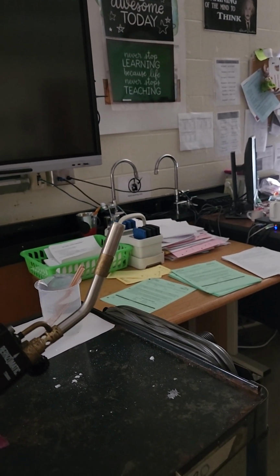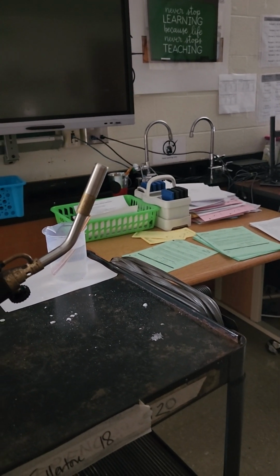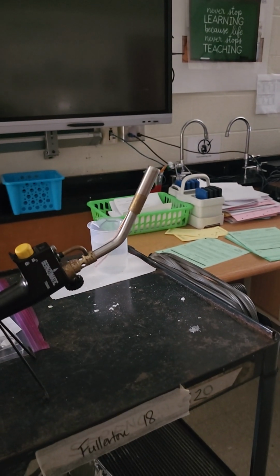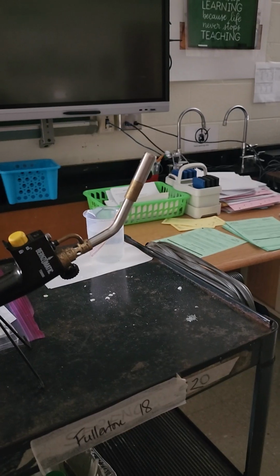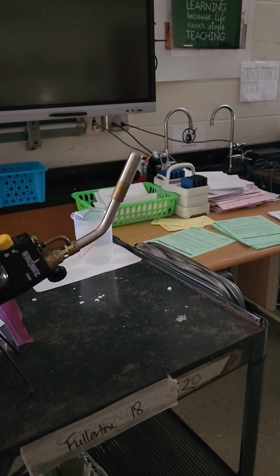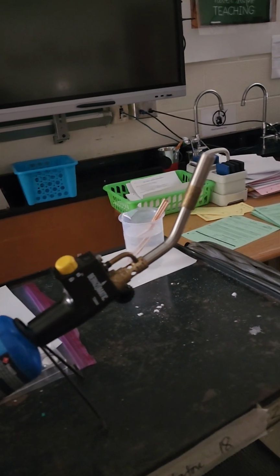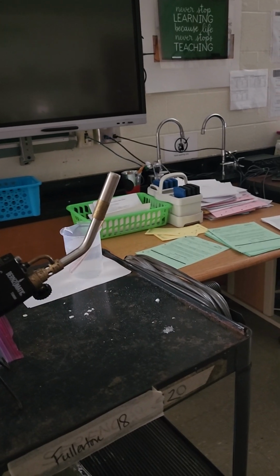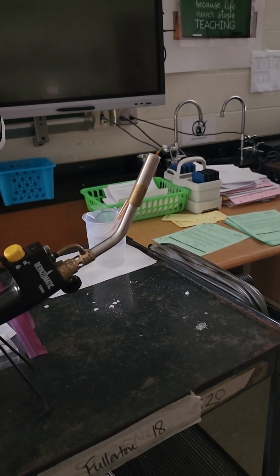So now that you have seen the four unknowns, go back and try to identify which the matching one is. You then have five closure questions based on what you saw. Make sure that you go back and answer them all. Remember, these are all metals, but they have to be combined with chloride to make them stable in the atmosphere, as we've talked about. And so then we use them and see them, and they give off a very specific color as their electrons are heated and cooled down.